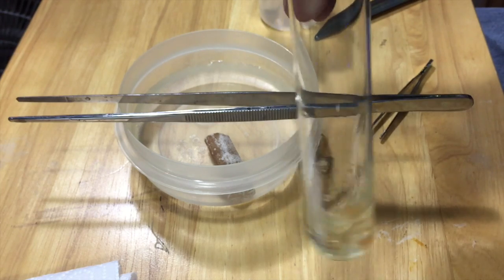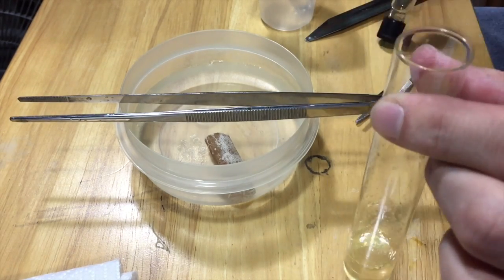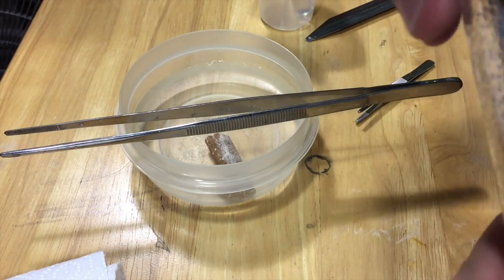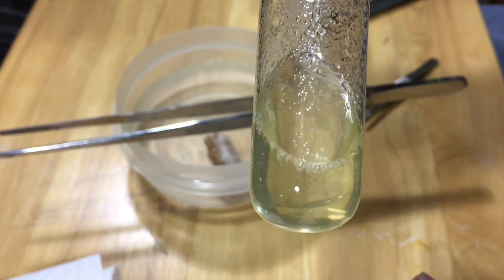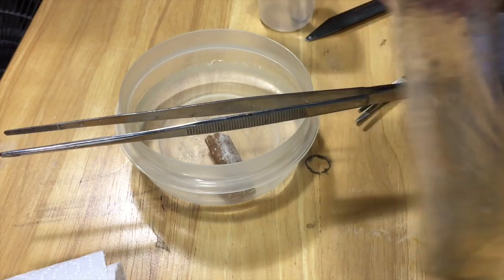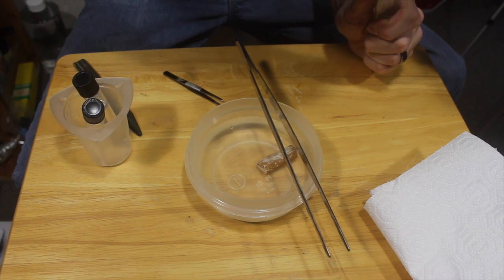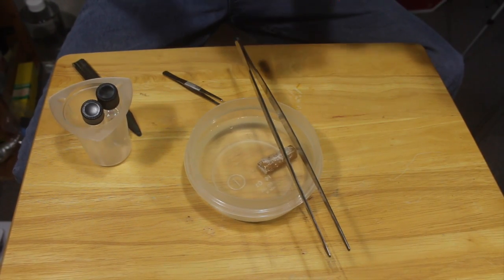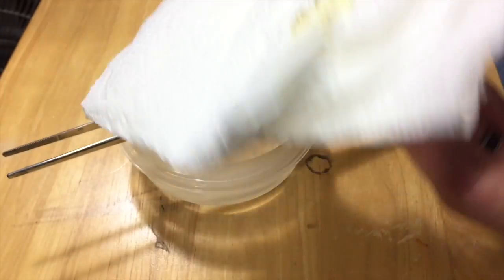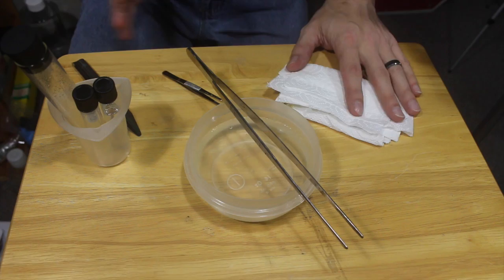So that's our phosphorus in there dissolving in the carbon disulfide. We've got a nice little solution — it's dissolved and turned a little bit yellowish. You can see it's gotten a yellow color, and that's from the phosphorus dissolved in there. Give it a real good shake. I'm just gonna vent that because there's a little pressure built up. We'll wipe that off because it does have phosphorus in it. Look at that — it has already burned several little places on these paper towels, so you can see just how quickly that will react. Very cool. We're gonna go outside so we don't set the house on fire.